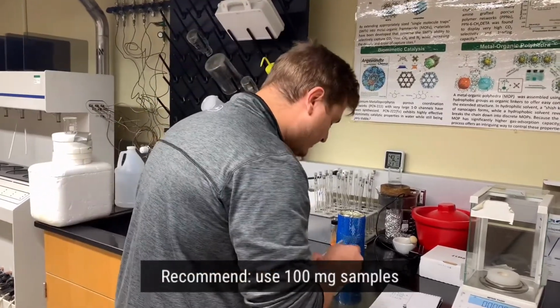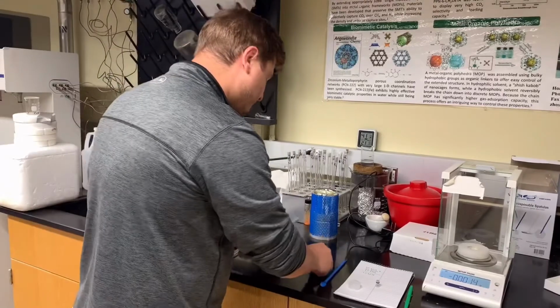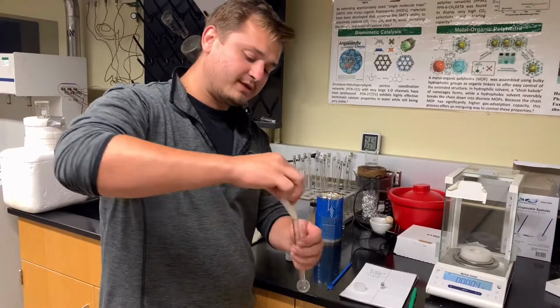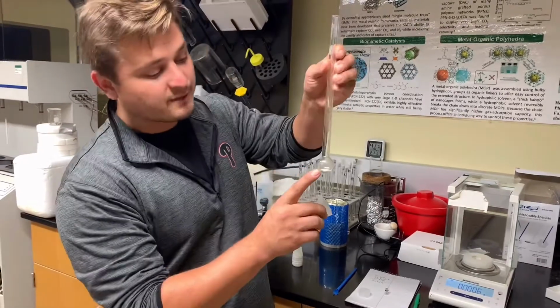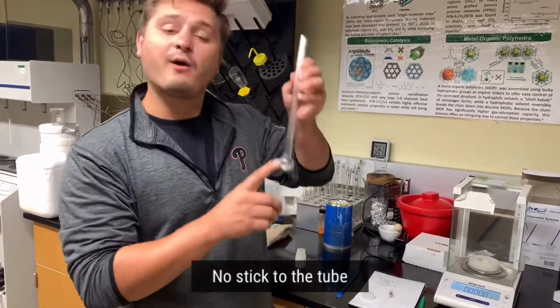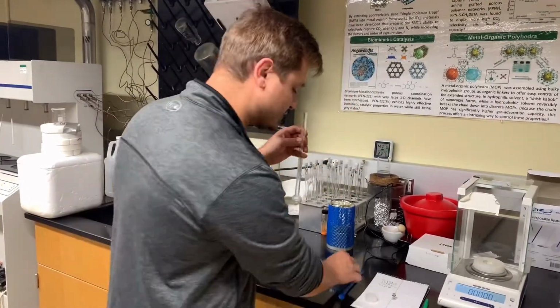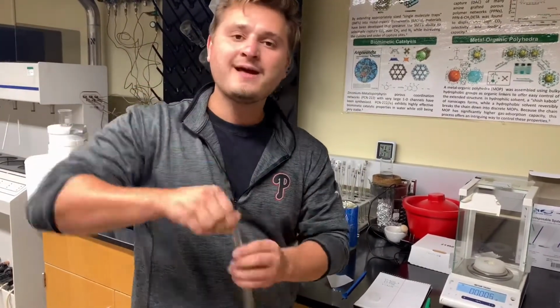So what I will do is I will take a little bit of the sample, I will take it off, I will put it on a piece of weigh paper, then I will take some of the weigh paper and I will funnel it into the sample tube. There are all sorts of different ways that you can input sample into the tube, but you just need to make sure it comes to the bottom, that it does not stick on the sides of the tube, because then the analysis might have some error in it. So however you add it, 100 milligrams of sample approximately, and make sure it all gets to the bottom of the sample tube. Once we add approximately 100 milligrams of sample, we will then go ahead and close the sample tube and get ready to put our sample on the activation or degas port.